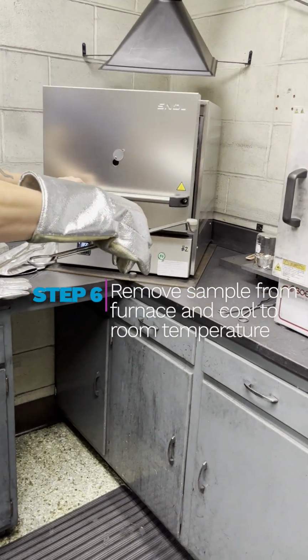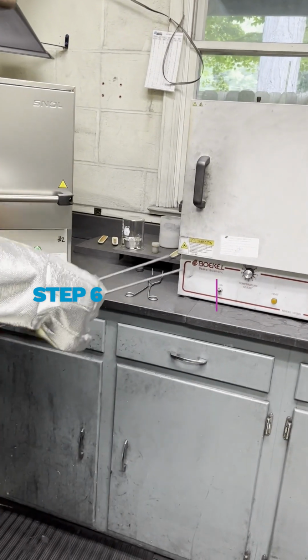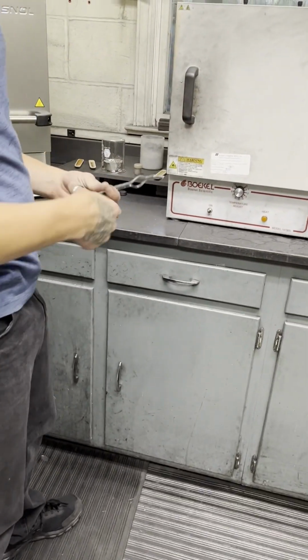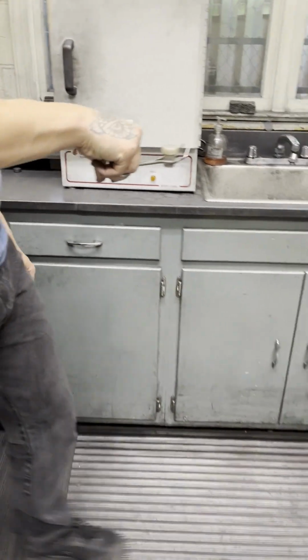You could place this in a desiccator if it's metal. If not, just putting it on a standard graphite block and allowing it to cool will suffice. Okay, now that the volatile cooled off completely, we're going to place it on the scale and we're going to measure its weight.